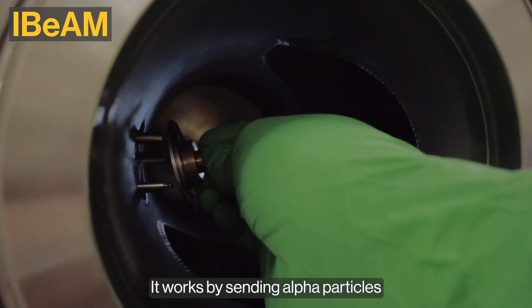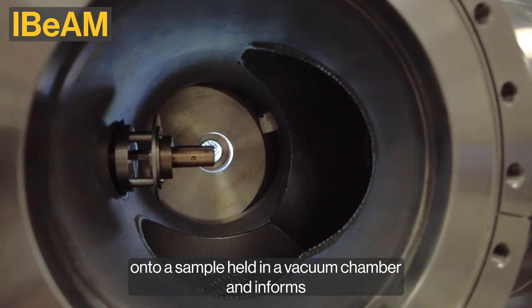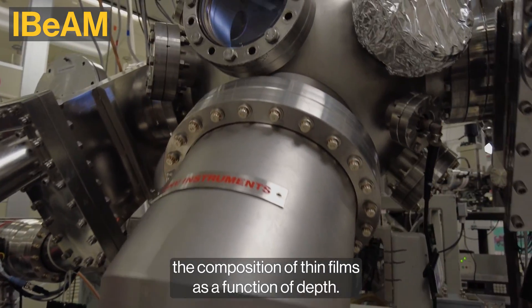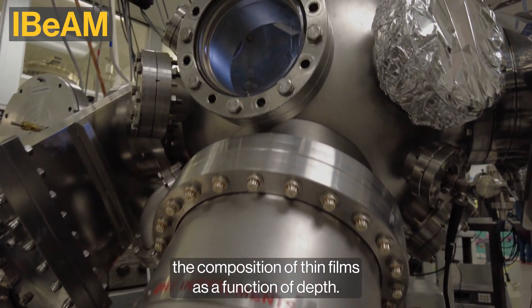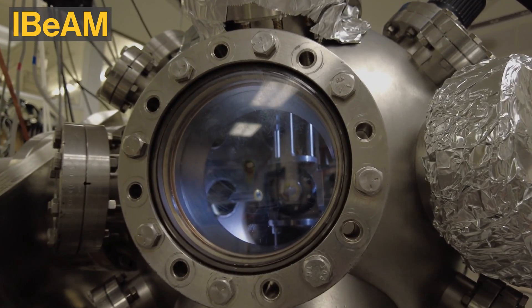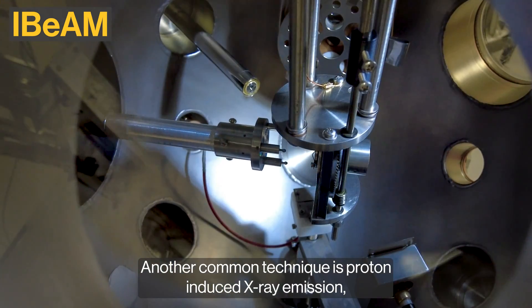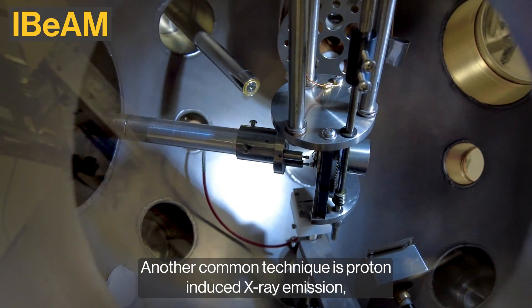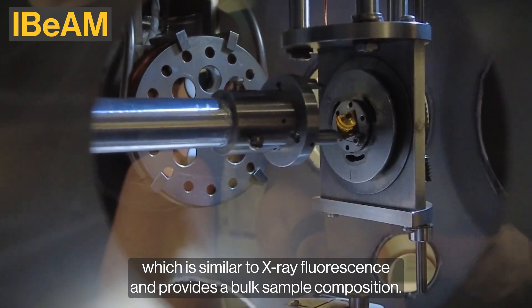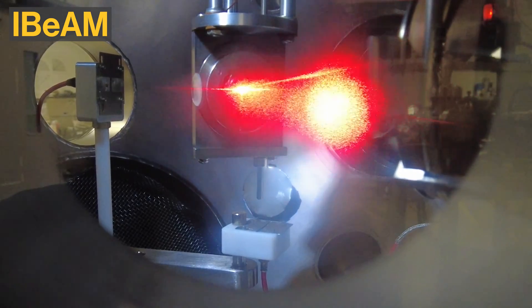RBS works by sending alpha particles onto a sample held in a vacuum chamber and informs the composition of thin films as a function of depth. Another common technique is proton induced x-ray emission, which is similar to x-ray fluorescence and provides a bulk sample composition.